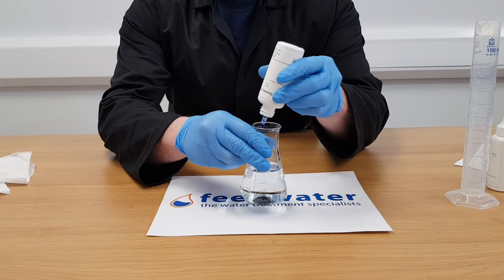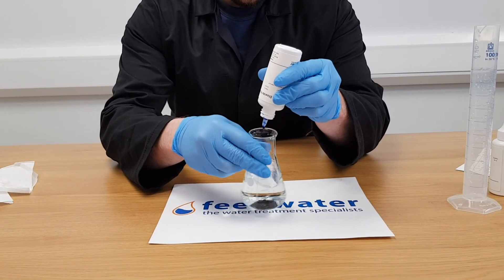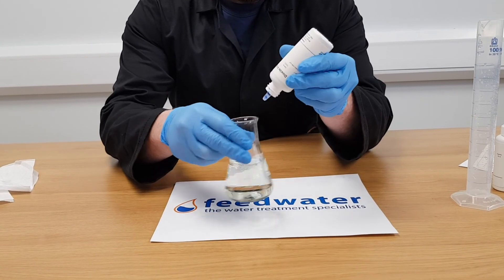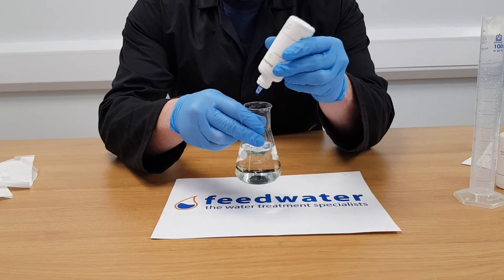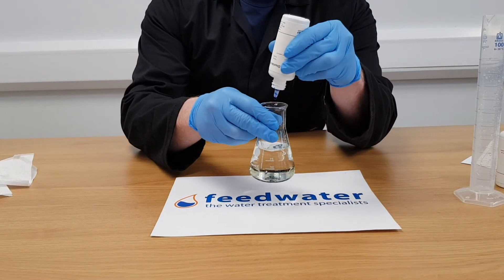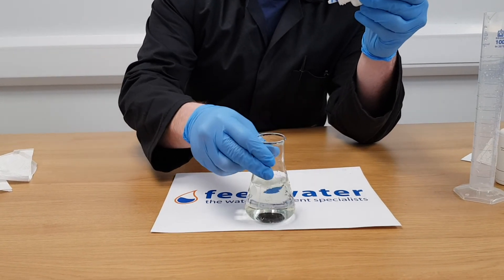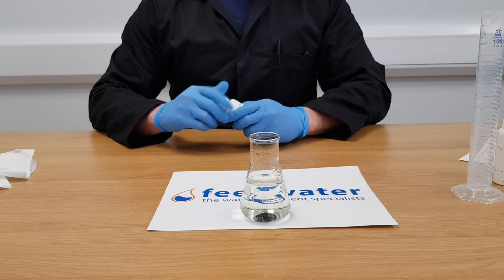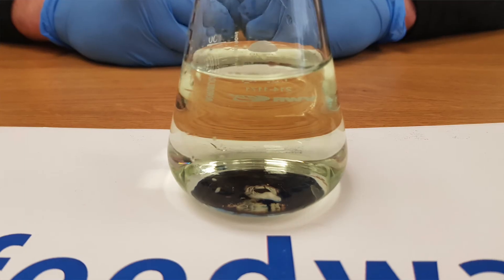Look out for an end point that goes through a yellow-green before reaching blue. This can sometimes happen on high alkalinity waters and it can be the cause of inaccurate results. If the sample starts to go yellow then green throughout the titration, discard the sample and start again, this time adding an additional 10 drops of CDO1 buffer. Repeat until you see a distinct end point changing from colourless to blue.